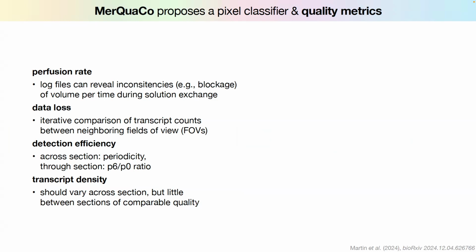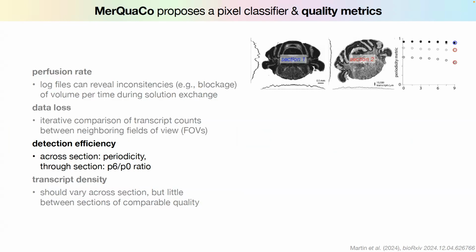And I just want to show you one example here where they say, if we just count the total number, we do a histogram of the transcripts from left to right and from top to bottom. Of course, this will depend on the orientation of that section. So here it's really nice, and then here it's different because this is tilted. But if you had consecutive sections and they're registered, it should look the same, more or less. And then they say, okay, for the first one, it's pretty good. But for the second one, it's much lower, and there's a drop. So something's weird.